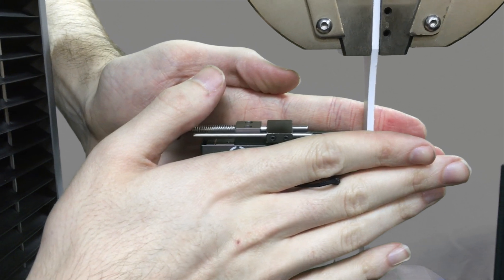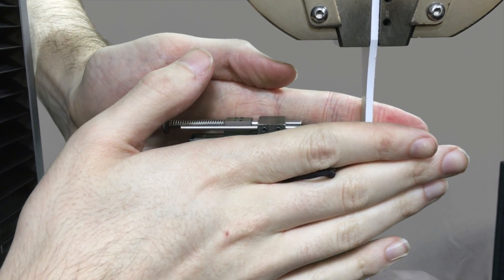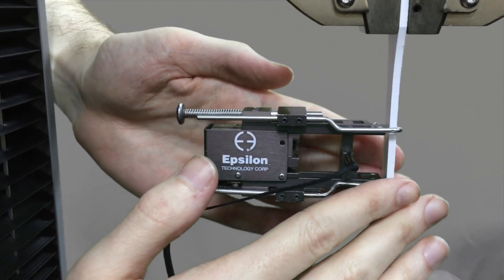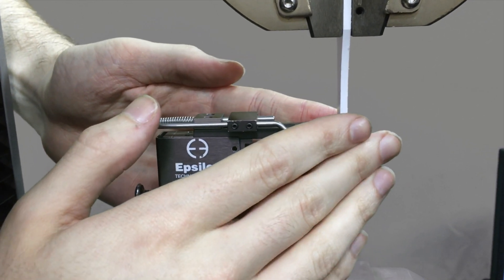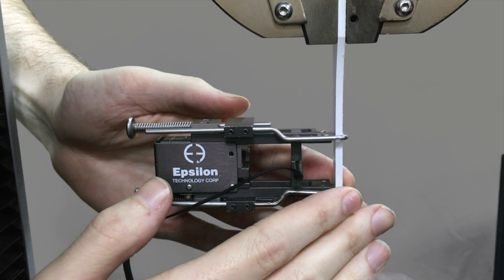You can bring both hands to the side, kind of like this, and really make sure that both teeth are level and perpendicular to the sample.